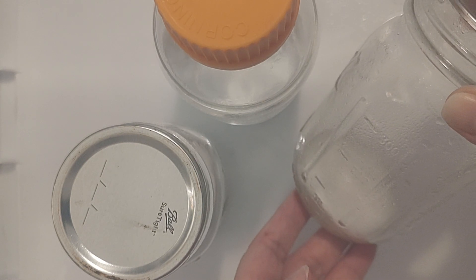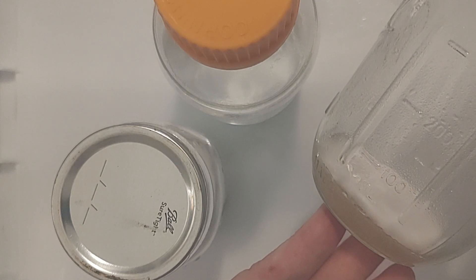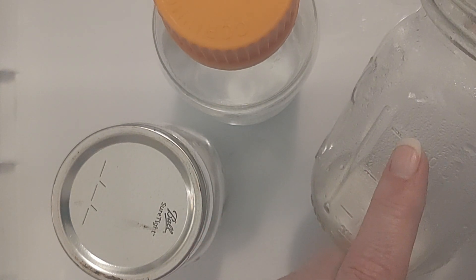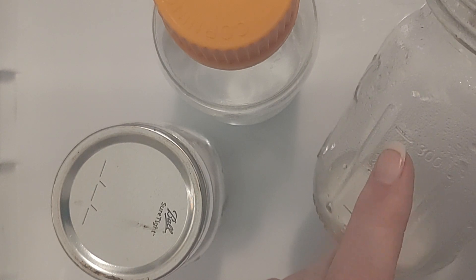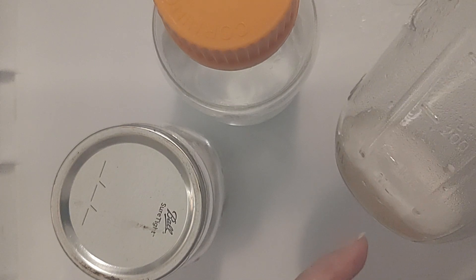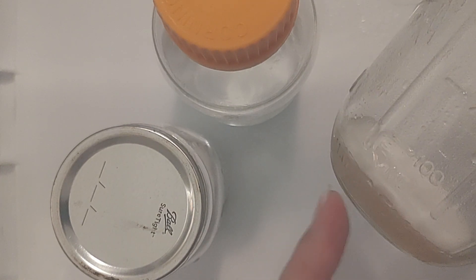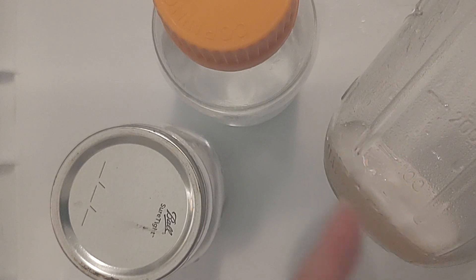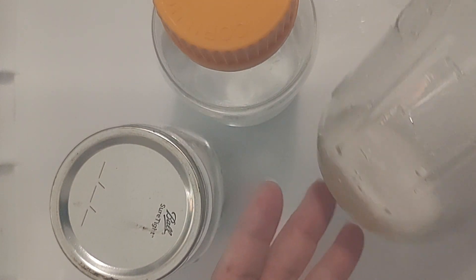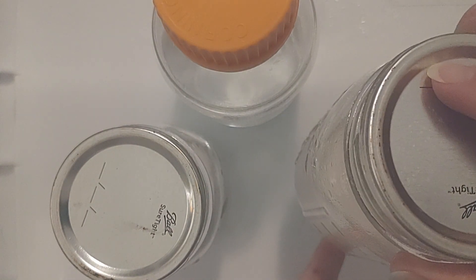When we tried this before, we experimented: one with 100 milliliters, another with 200, and another filled up to 400 milliliters. The ones with more water — they didn't break up. The mycelium is gorgeous in there, but there's a giant agar plate just swirling around in the jars, and that's not what we want. We want it to be a slurry and break up that agar at the bottom. So we're going to do this here in this video together.